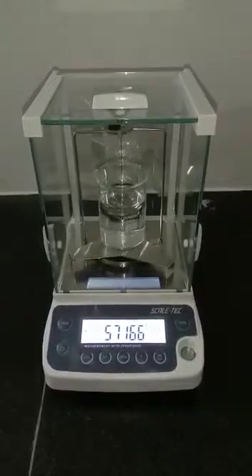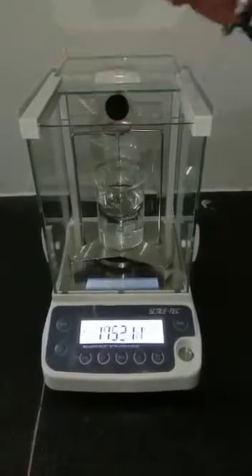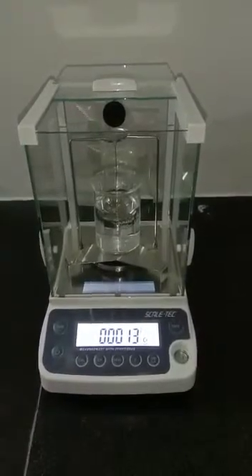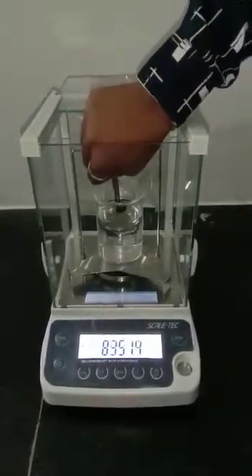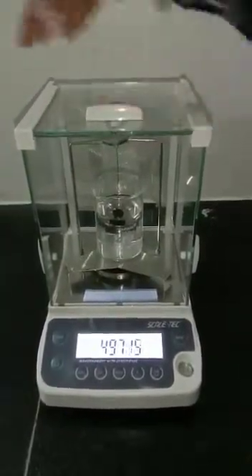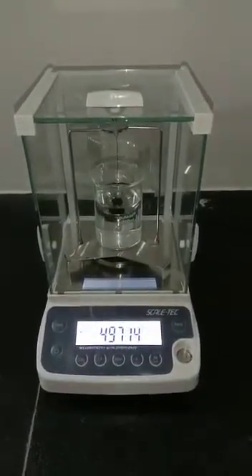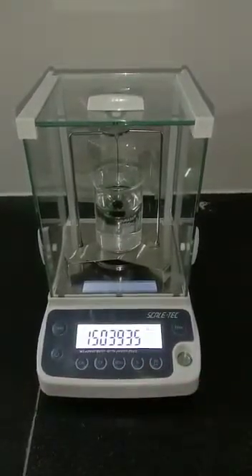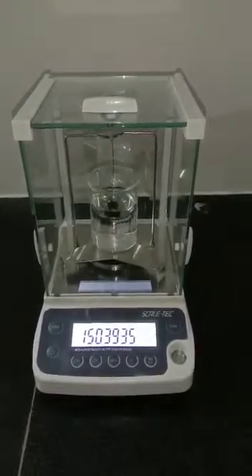Now it will ask for weight in liquid. With the help of tweezers, put the material inside the hanging plunger. Whenever the digits are stable, press F and you can see the result. This result is the density of your particular material. Thank you so much.